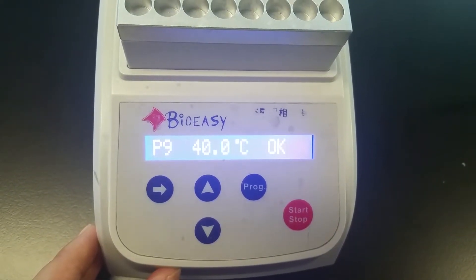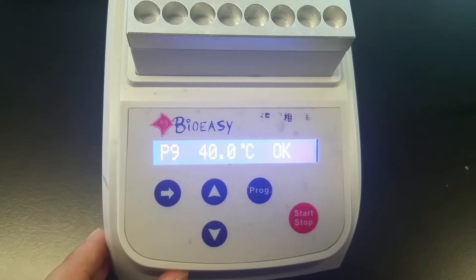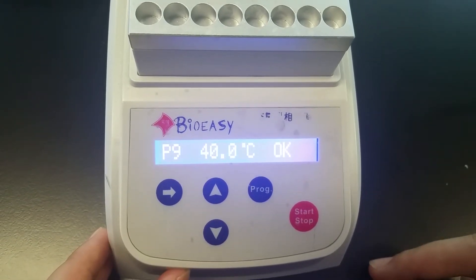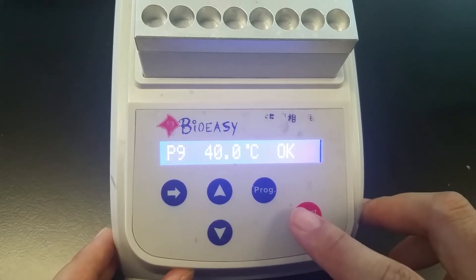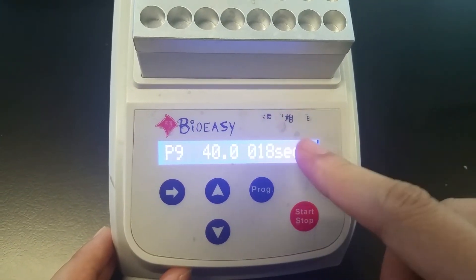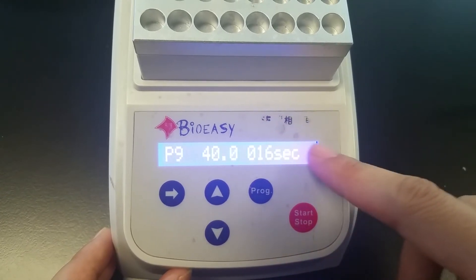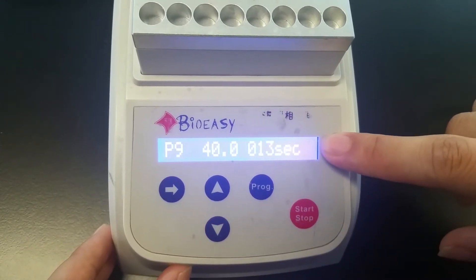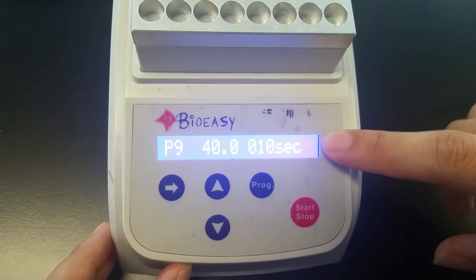Now we can see how the program goes. So when we do the experiment, we can press the start button. We see the first round incubation begins, and only one square is showing on the right corner.